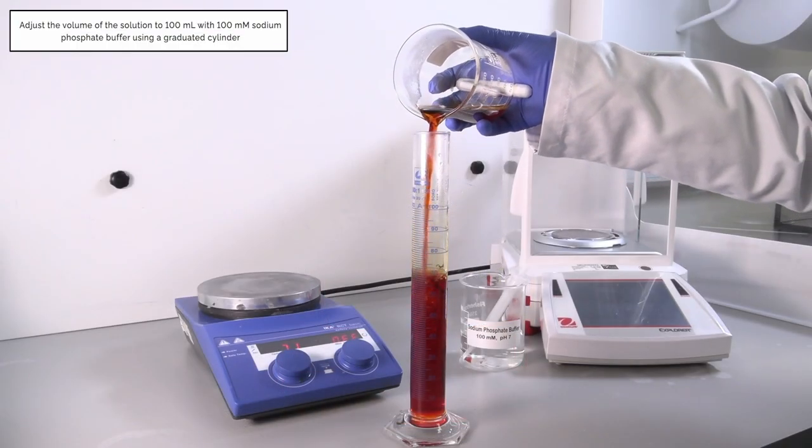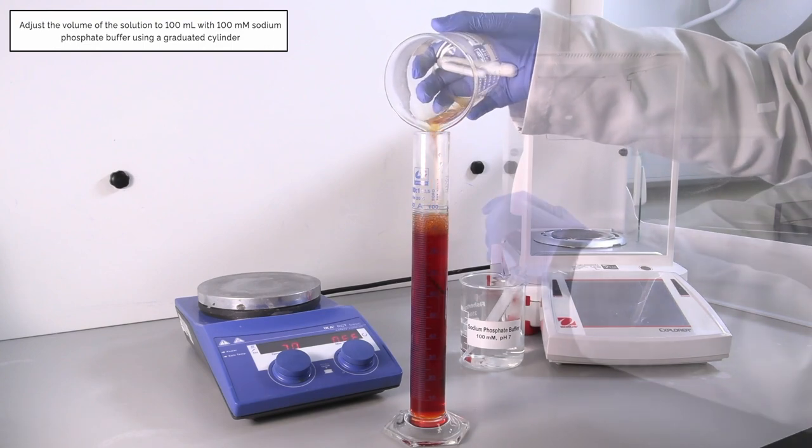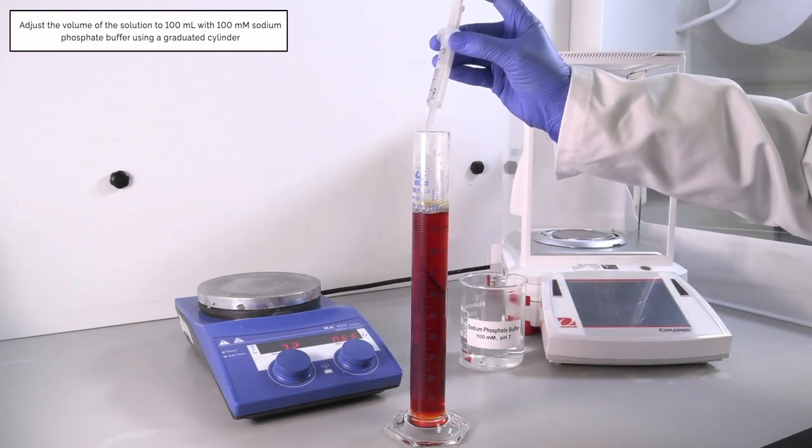Adjust the volume of the solution to 100 milliliters with 100 millimolar sodium phosphate buffer using a graduated cylinder.